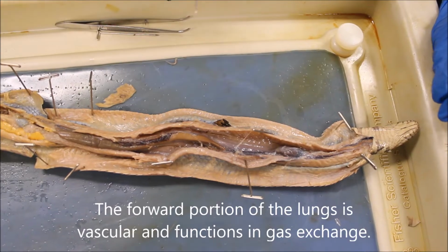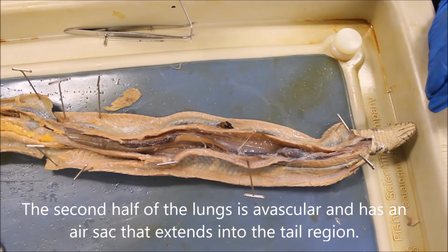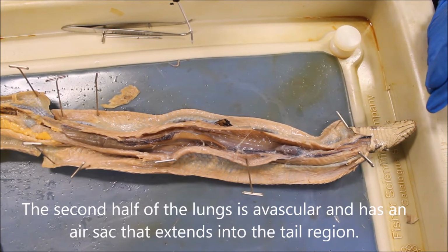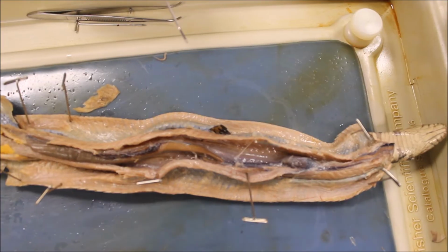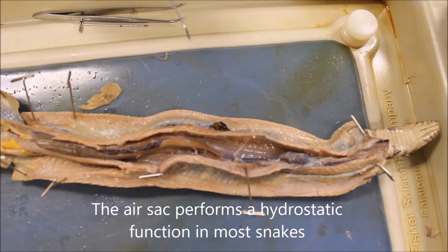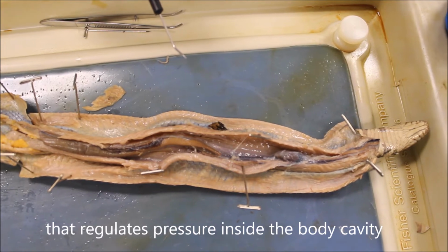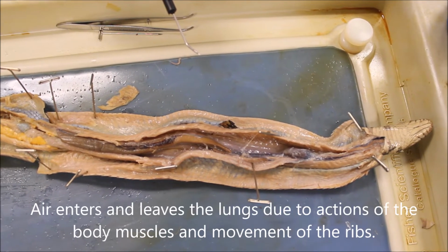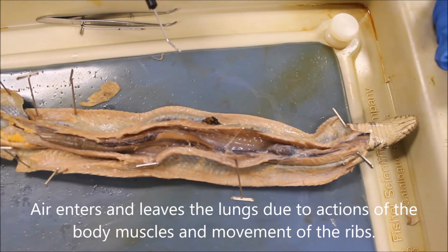The forward portion of the lungs is vascular and functions in gas exchange. The second half of the lung is avascular and has an air sac that extends into the tail region. The air sac performs a hydrostatic function in most snakes that regulates pressure inside the body cavity. Air enters and leaves the lungs due to action of the body muscles and movement of the ribs.